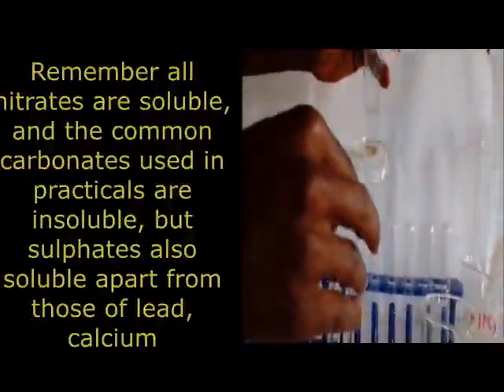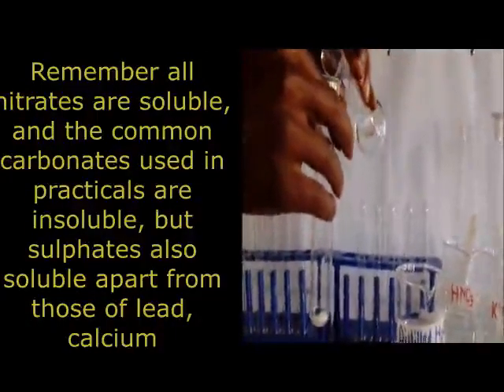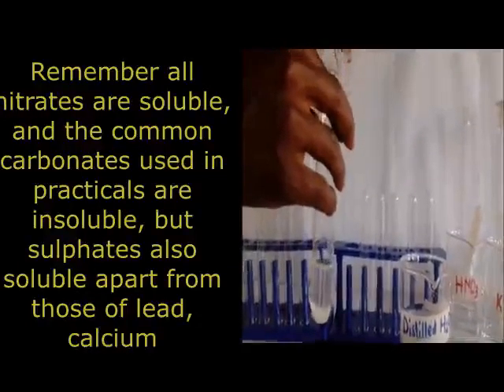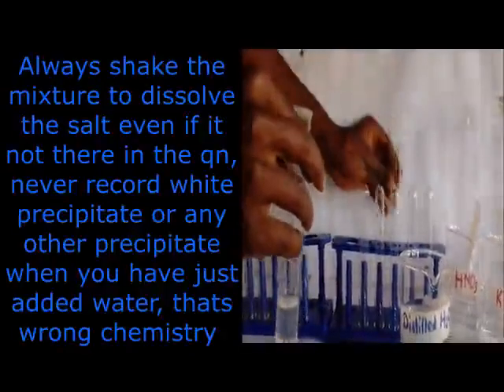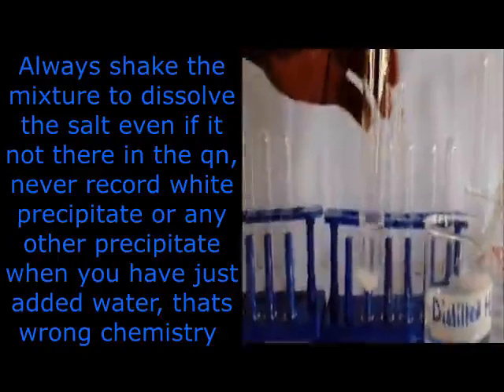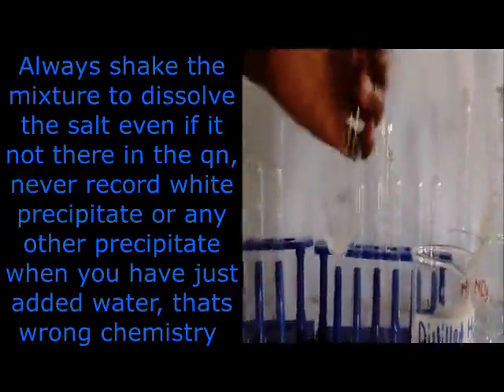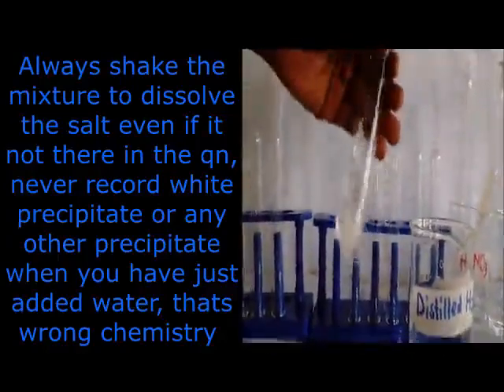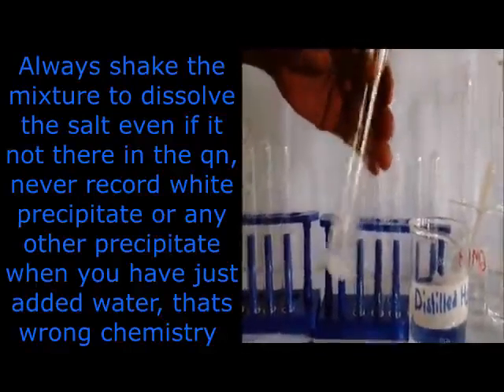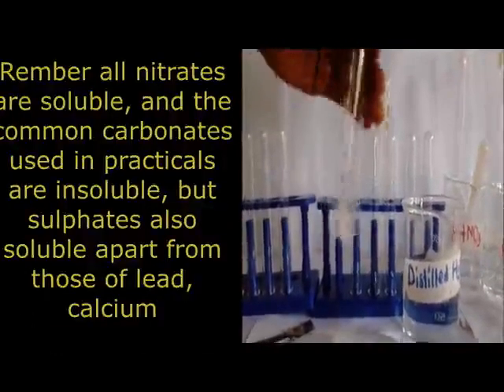Now you can see we measure our water. After measuring our water using the measuring cylinder, we transfer the water into the boiling tube or the test tube, which has our sample. So we have our test tube having our sample, then we add our water. Then as we are adding the water to the sample, what is the next step? We are going to shake. So we add our water properly, taking some care to avoid wetting, for example, your working place or even the paper. Now you shake properly.